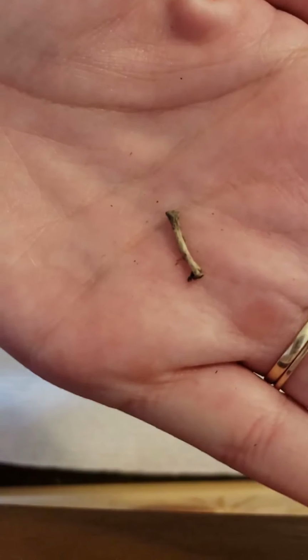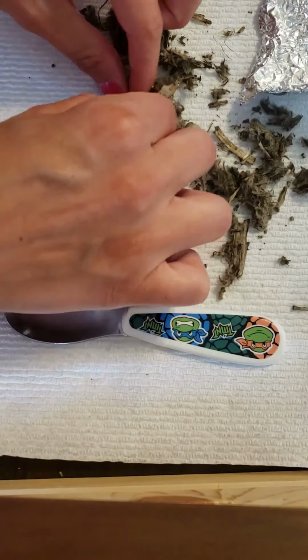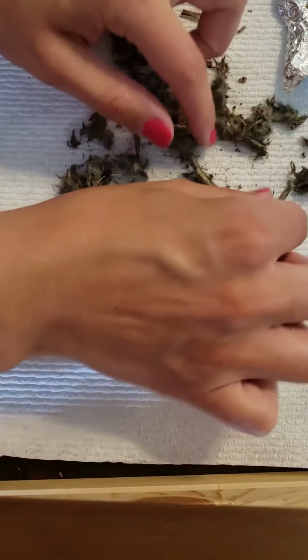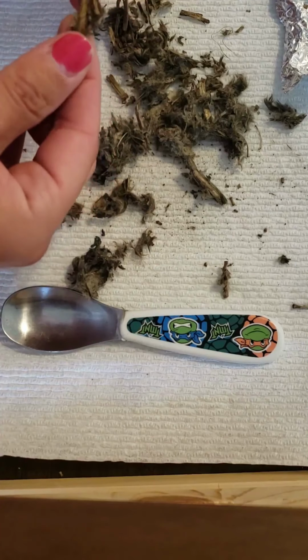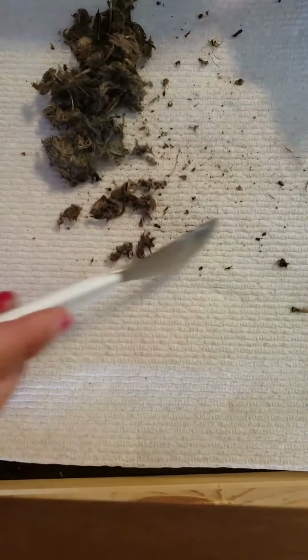So I found another one, and I'm thinking that this one might be it for this one. Here's one. I don't know if that was already in my pile or not. This one. But no, I don't think so, buddy. So I'm thinking that's all for that one. So let me just scoop this up real quick.